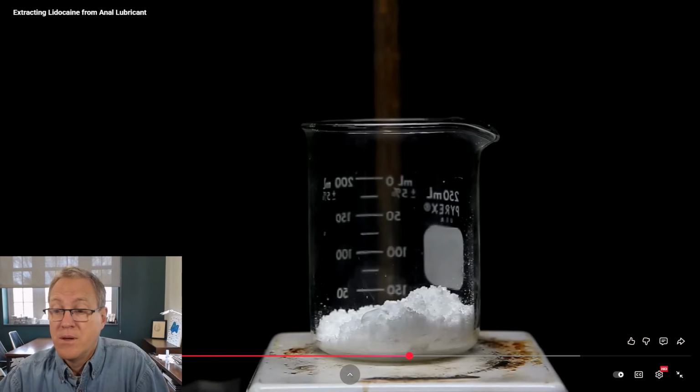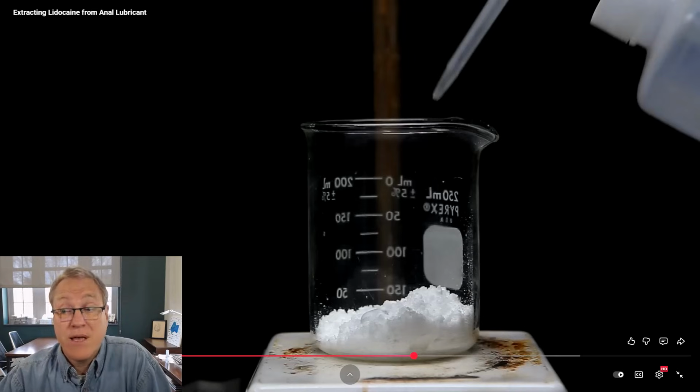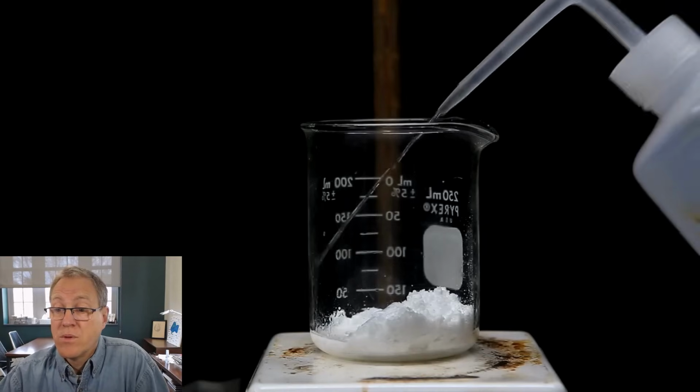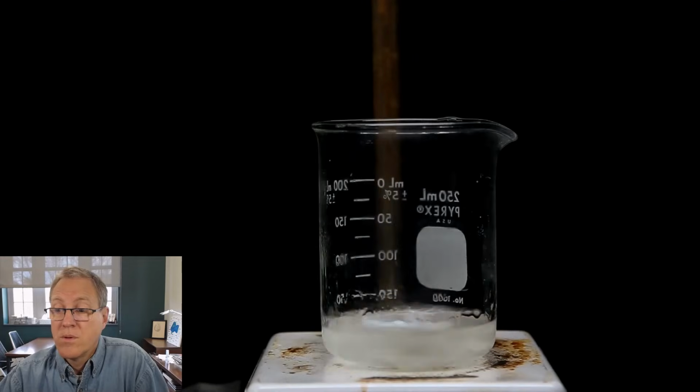Deceiving. To clean it up, we add it to a beaker and we drop in a stir bar. Yeah, to clean it up. Looks good. Well, what is there to clean? But he knew something is not right here. Then, using a squirt bottle, I add in ethanol until all of the lidocaine dissolves. Lidocaine is extremely soluble in alcohol, so it really shouldn't take a lot to dissolve everything.